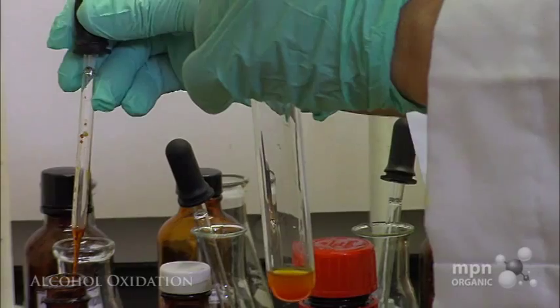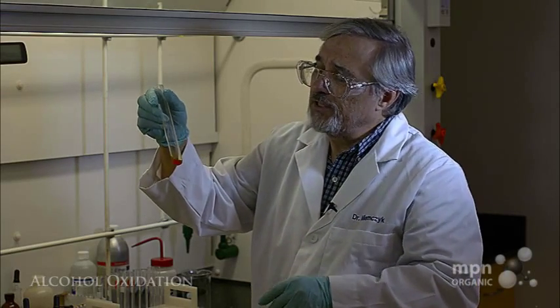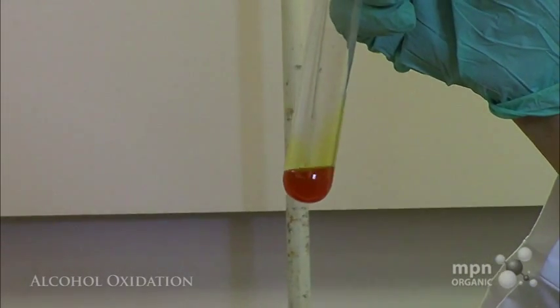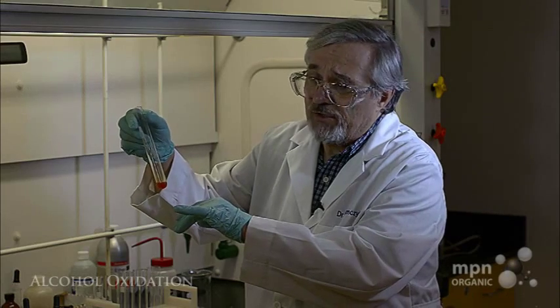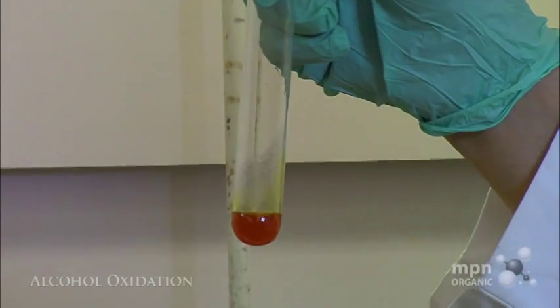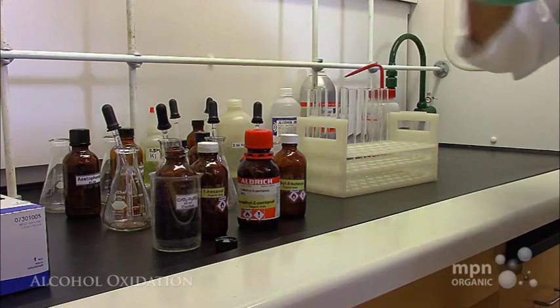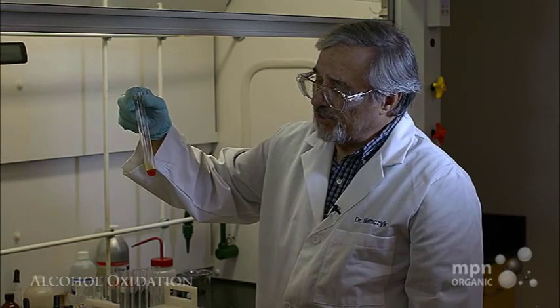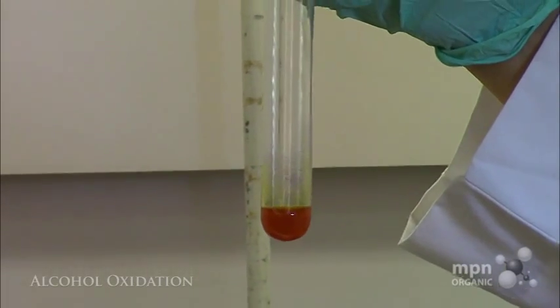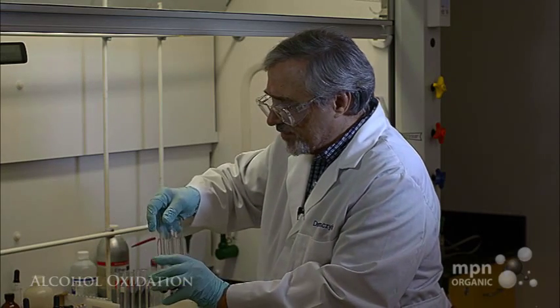Okay. You'll see that while there is a very slight color change, it's largely the color of what is now the dilute chromic acid solution, so that the tertiary alcohol resists the oxidation reaction that we saw for the two other alcohols, the primary and the secondary alcohol. So there it is. So we can distinguish now very rapidly between primary, secondary, and tertiary alcohols as our second category. And let's just bring these two up to you now.